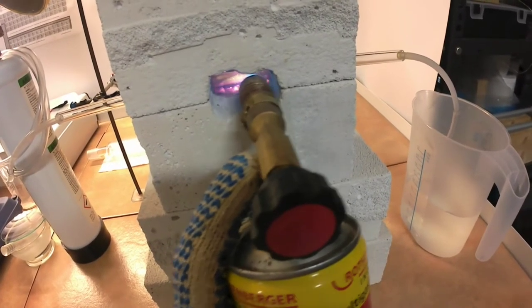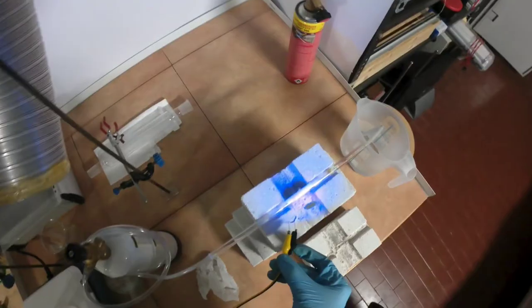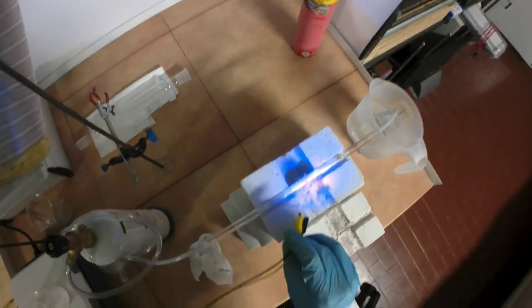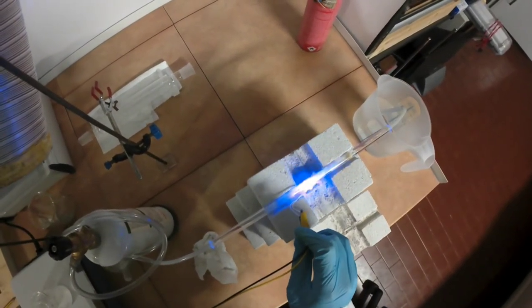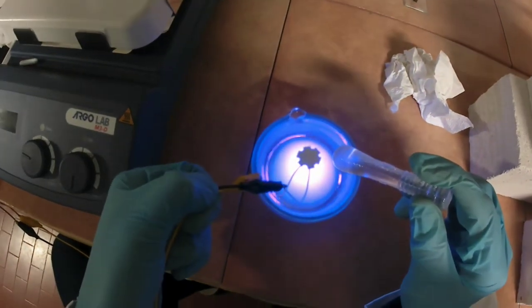Eventually, I discovered that this was partly due to purity issues in the silver nitrate I used, and partly due to the need to add a small amount of pure sulfur before firing the phosphor.